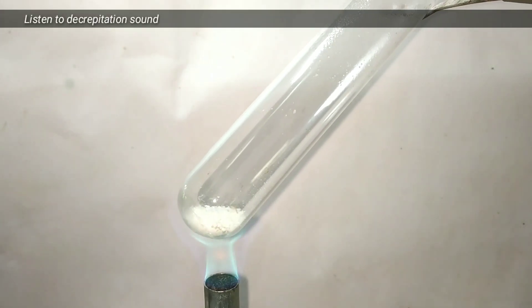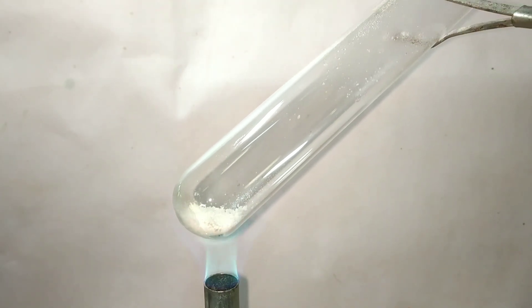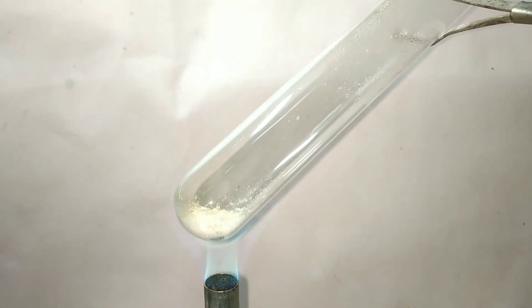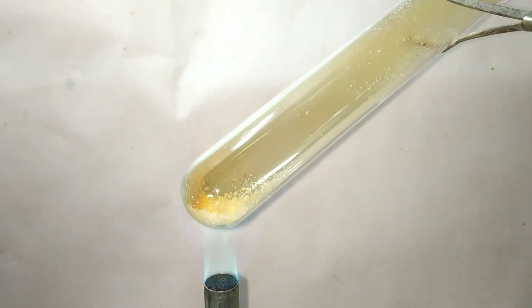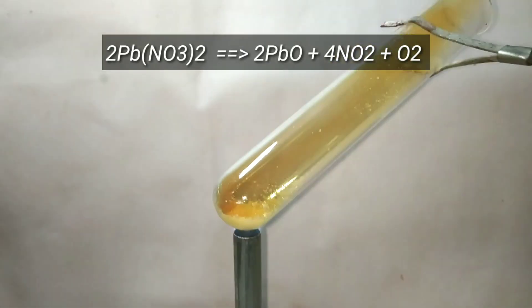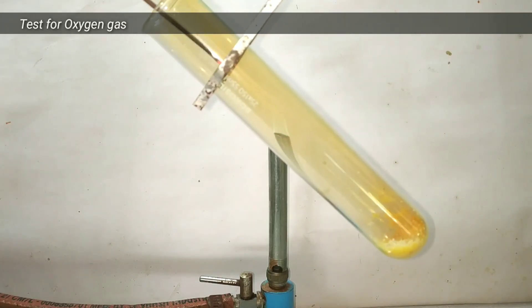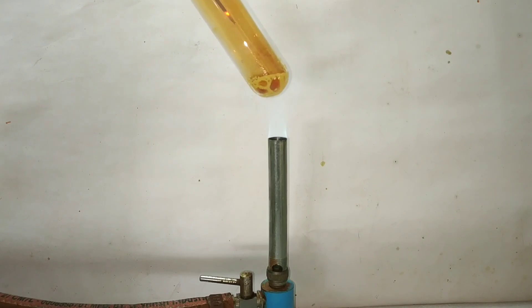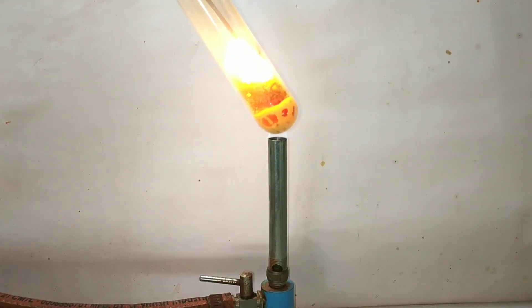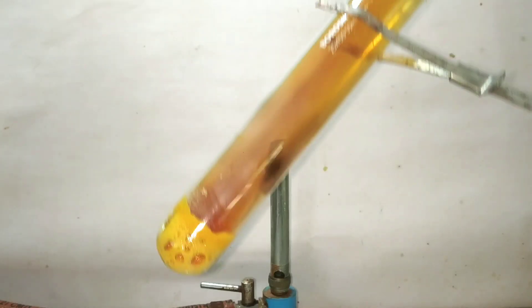After some time we can hear this characteristic popping sound. What is happening here is lead(II) nitrate is getting thermally decomposed to form lead oxide, nitrogen dioxide — the brown gas — and oxygen gas. We can test for the presence of oxygen by inserting a glowing splinter into the test tube, and as you can see it gets re-ignited, as the oxygen produced in the reaction is a supporter of combustion.